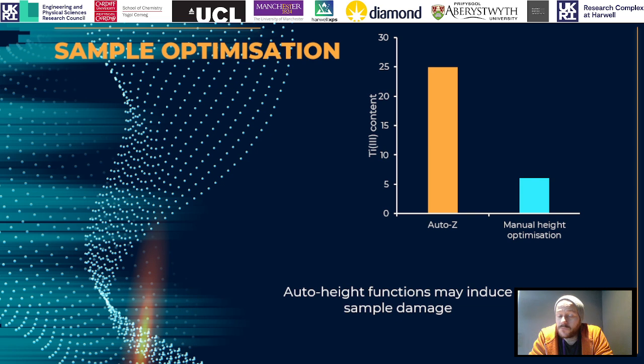Sample optimization. So in a lot of modern spectrometers, it's quite common to have an auto Z function, so you can put your sample in, turn the beam on, and tell the software you want to find the height of the sample and line that up with the focal point of the X-rays. Now, of course, while you're doing this, the X-rays are on, and this is going to be doing some sample damage to sensitive systems. So the orange column here is the amount of titanium 3+ when we use the auto height function, and the blue is where we've done a manual height optimization. So this is just using the internal cameras and microscopes of the XPS to find the optimal height of the sample and not use the X-ray signal itself, because then we prevent this sample damage from having our X-rays on during the auto height. And this does of course mean that you need to have a well optimized camera to focal point position, but you should be looking to have that anyway. So this is one way that you can again just minimize the amount of reduction in your sample.